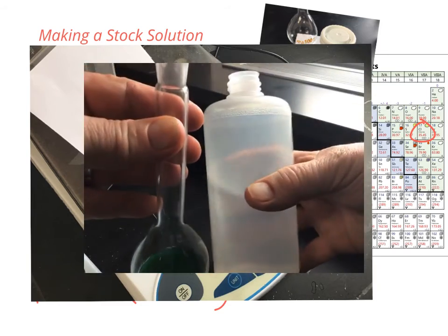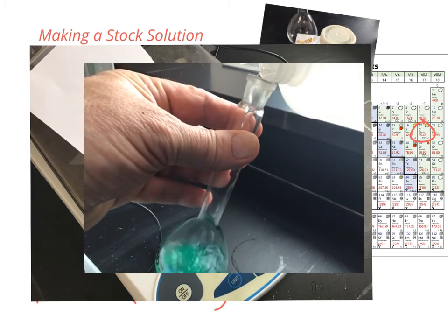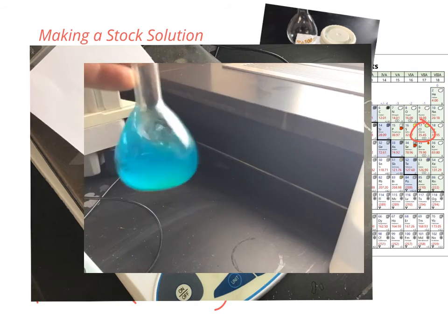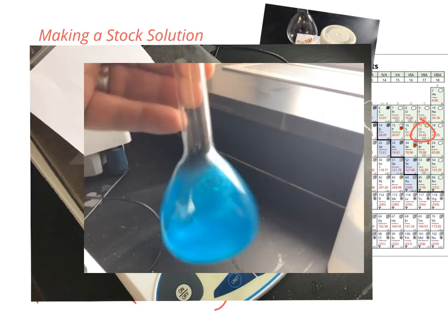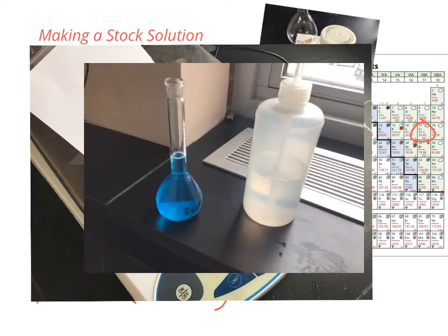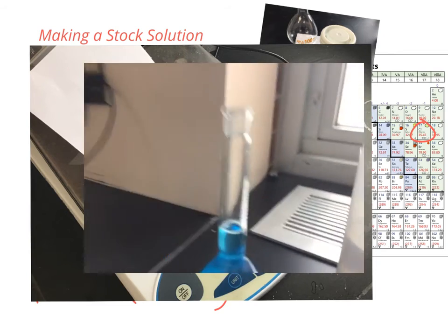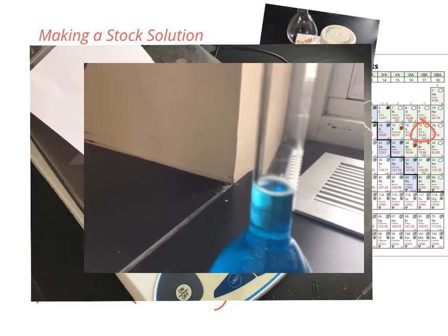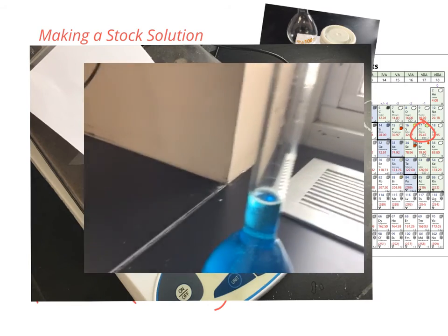Add some distilled water to the flask, not filling it up all the way. And then we can swirl and shake until it's all dissolved. The last thing we got to do then is add enough water to fill it to the precise volumetric line. And we'll do that with a precise dropper bottle.